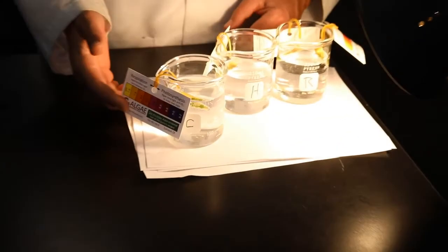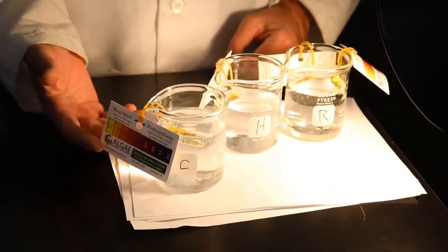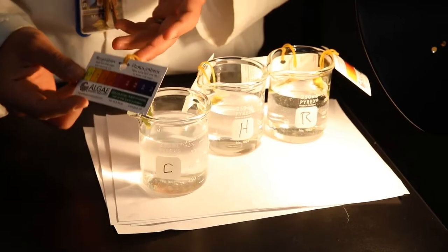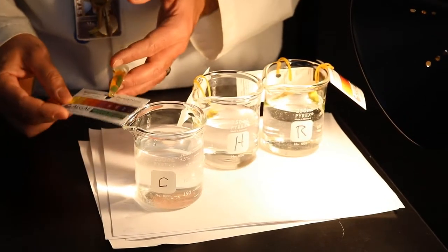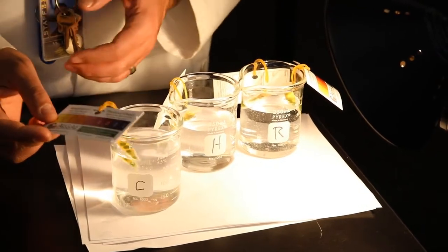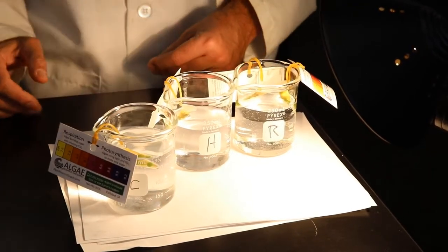We're here, ready to rock and roll. We're going to go ahead and record our last set of data for our 3 beakers. The first one, number 1, is our cold beaker. And over the 50 minutes, we've seen some change. So Mr. David, on number 1, we're going to record that as 7.4.